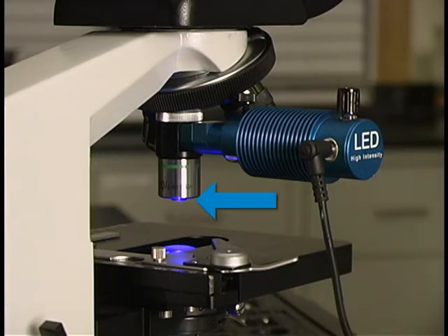If you fail to see this light, review your installation process. Make sure that all of the components are attached properly and that you have a stable electrical source.